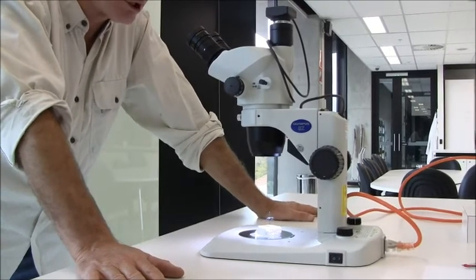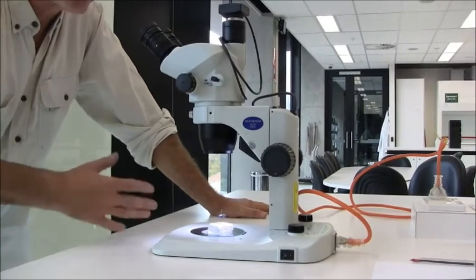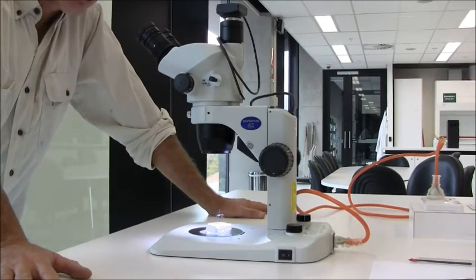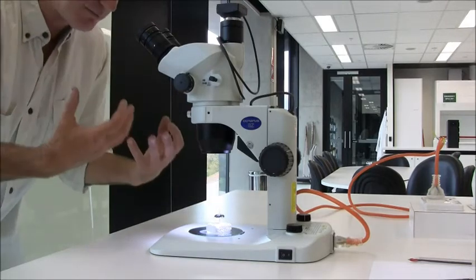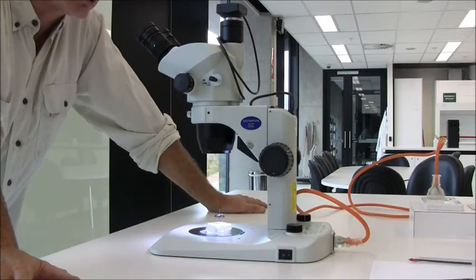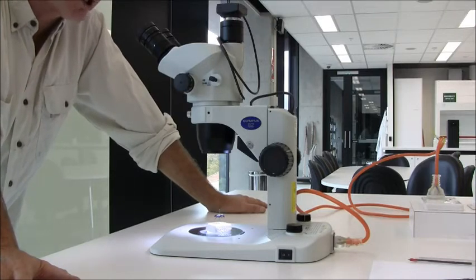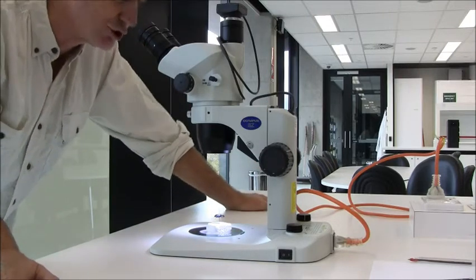And that's what you should do every time you approach one of these microscopes. You'll often be sharing it between students. But the person next to you may not have the same setup. Their eyes may be not quite focused the same as yours. And so a quick refocus is what you should be doing every time you approach one of these microscopes after someone else has used it.